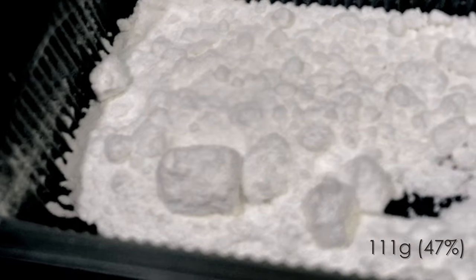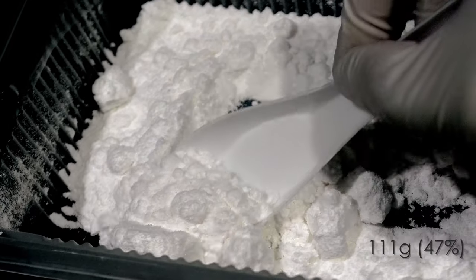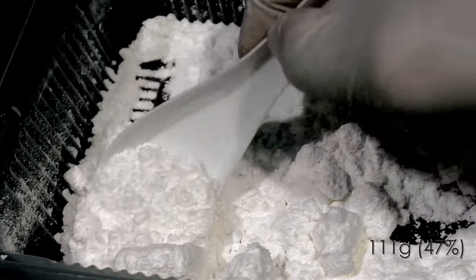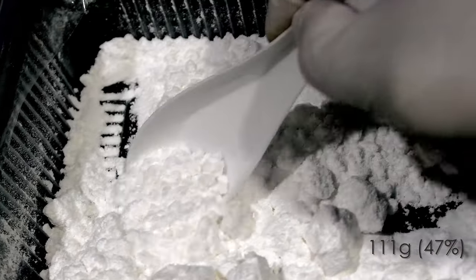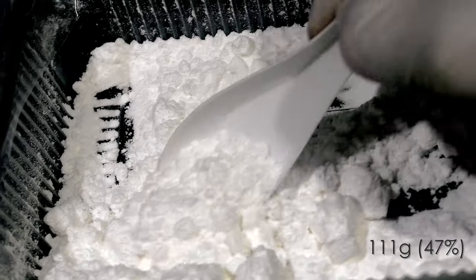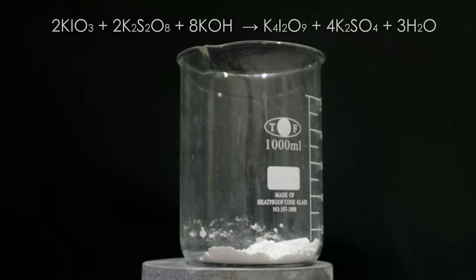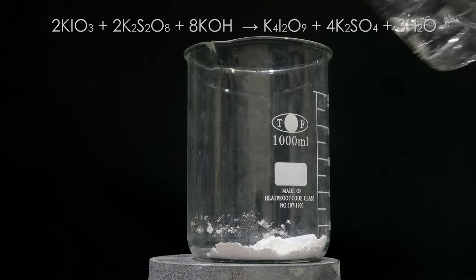The yield is 111 grams, corresponding to 47% based on iodine. Probably lots of iodine is still in the solution as iodate or iodide, so it might be worthwhile to recycle the leftover solution.